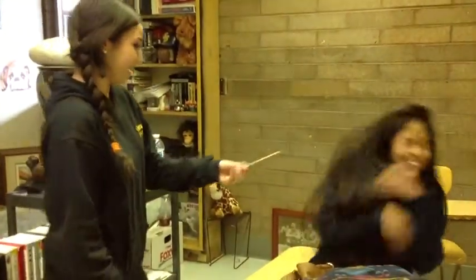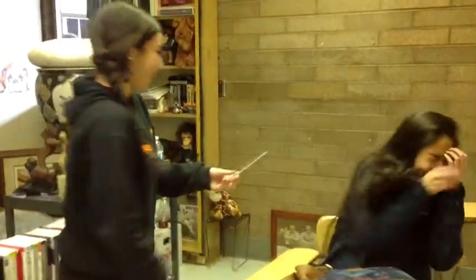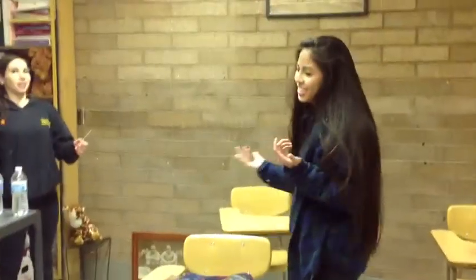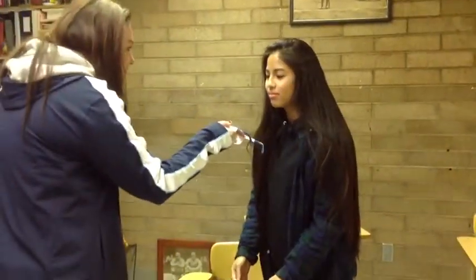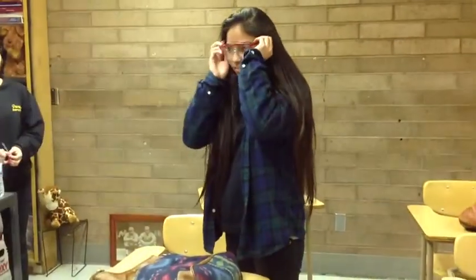While working in a lab, goggles should be worn at all times. Aw, Megan, you should have been wearing your goggles. Thank you, Jenny.